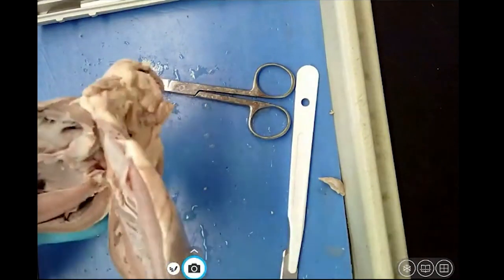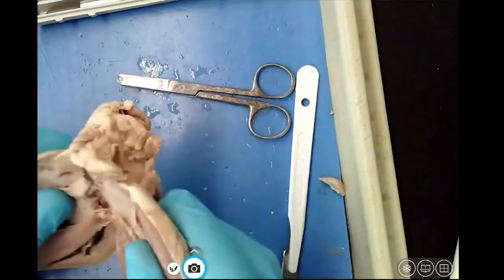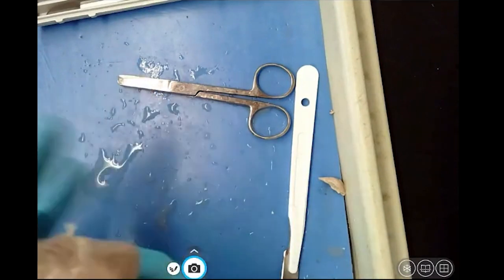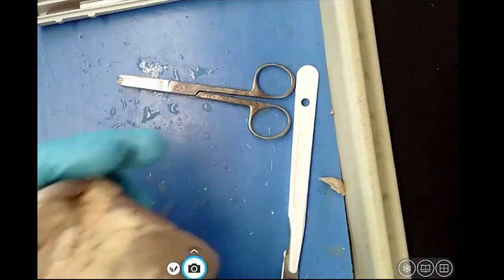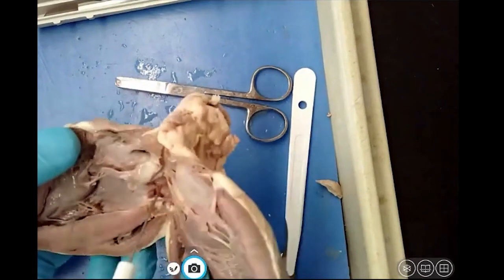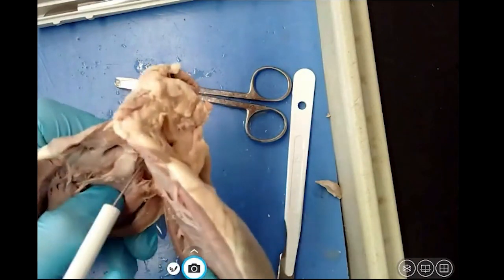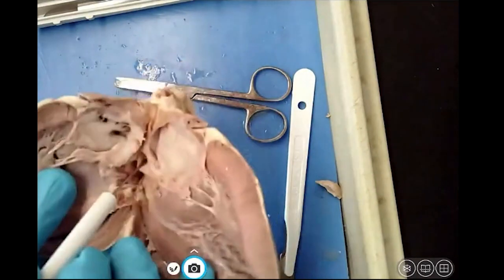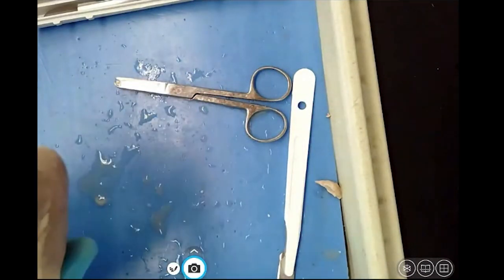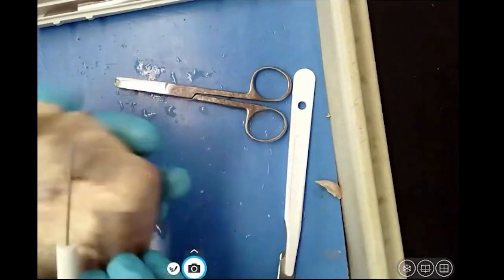So we got the vena cavas. Blood enters, fills, and then it's going to leave the heart through the pulmonary artery. Right there. So here's the vena cava, fills. It's got to get oxygen, so it goes through the next opening, which is right there, and comes out over here. Goes to the lungs, picks up oxygen, and comes back.